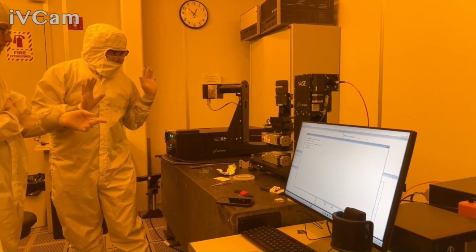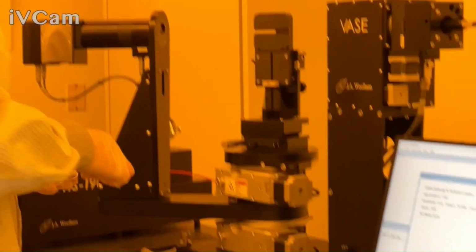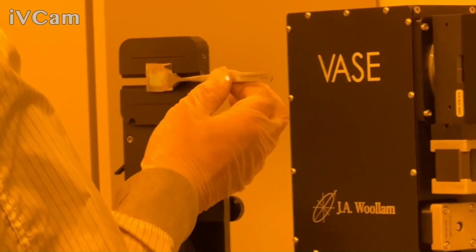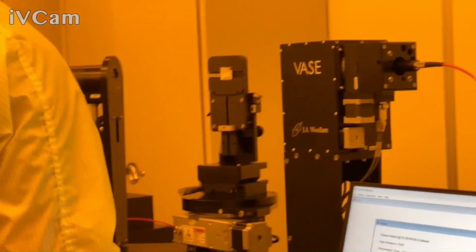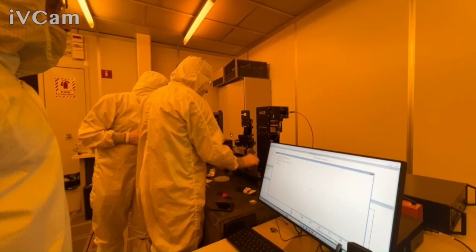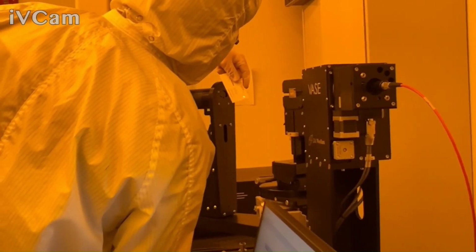You have a sample? Yeah, it's this one. If you want to mount it, we'll make sure the vacuum is on the small settings to hold where you want it. The fact you can see the beam on it means there's some scatter, right? And this is somewhat of a gradient, so you can also position it to make sure your beam is there. Before you put that in, my question would be, what does it look like afterwards? Is it squishing out at all? Because this is a bit of a gradient.